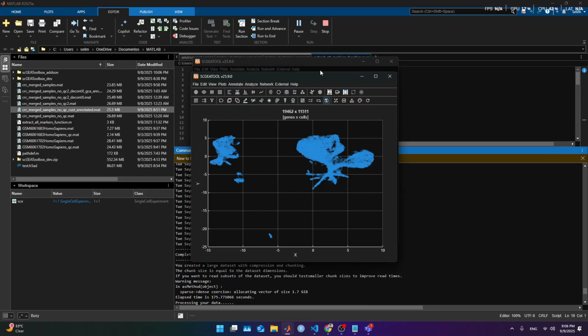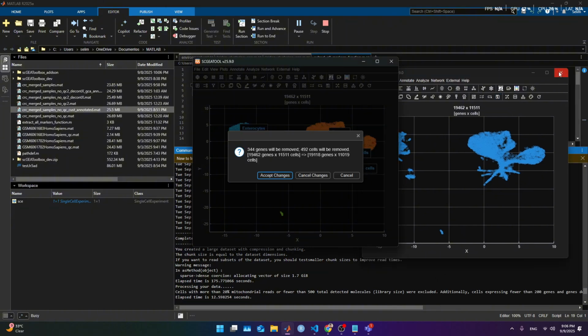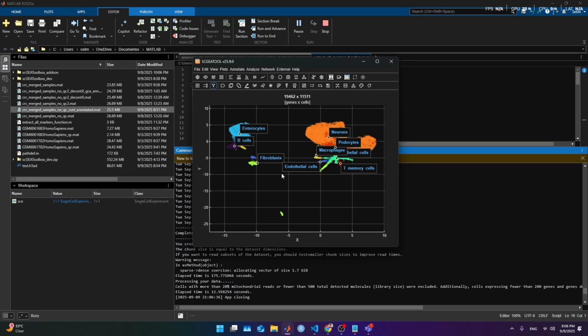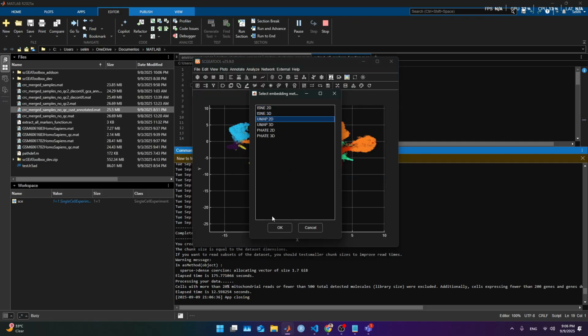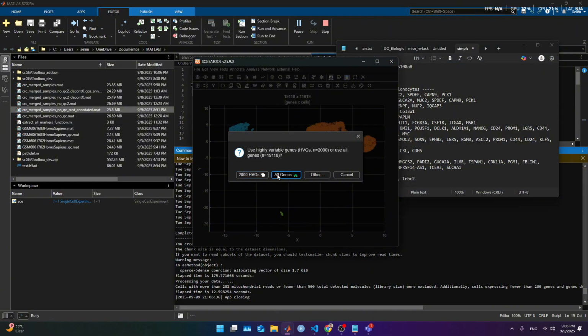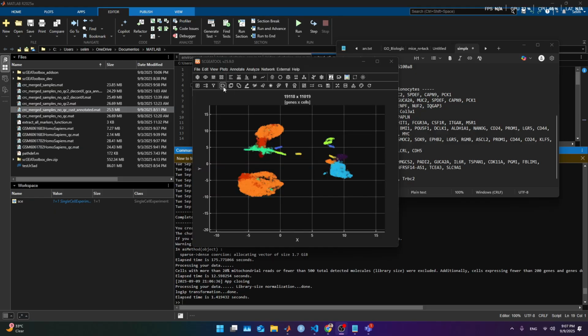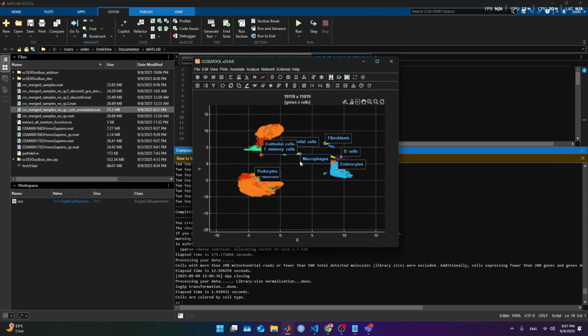What's happening with this other? I have 2 copies. I'm gonna close that, and it removed 500 cells. It's good. And now if we redo the UMAP, use existing no, UMAP to overwrite all genes, and we let it be. Coming back in a few seconds. And this is what we get. Now it seems to be less separated, and that is good. That's what I am used to looking at with this kind of samples. It looks a little better this time.